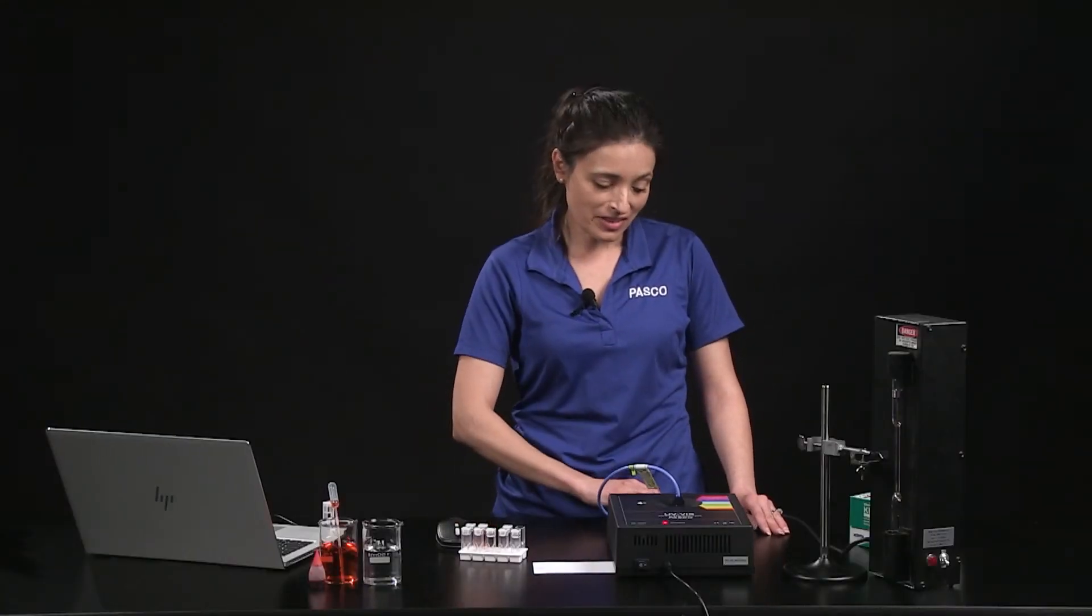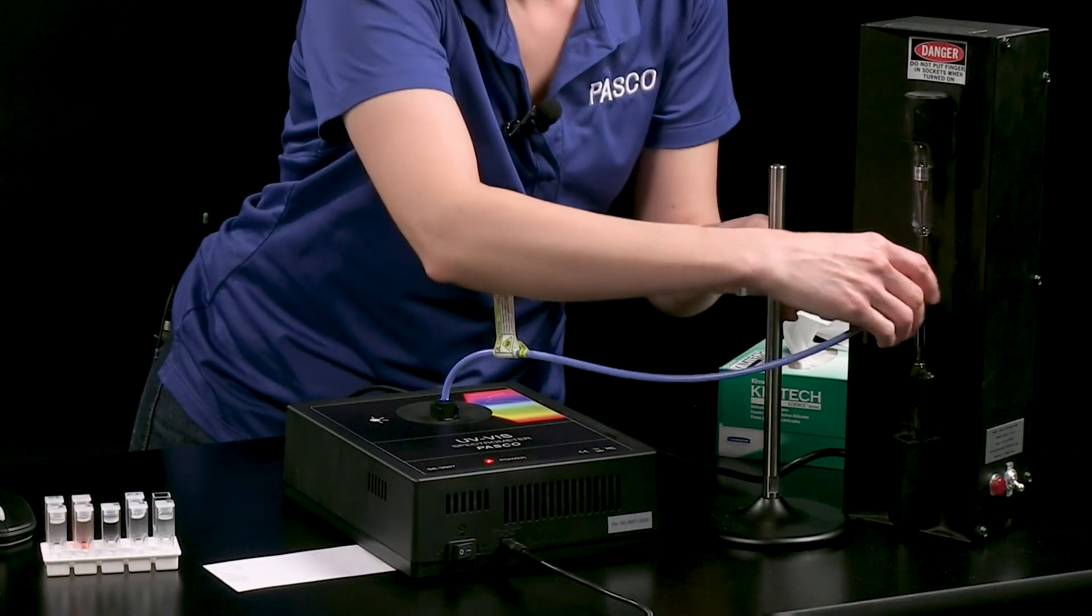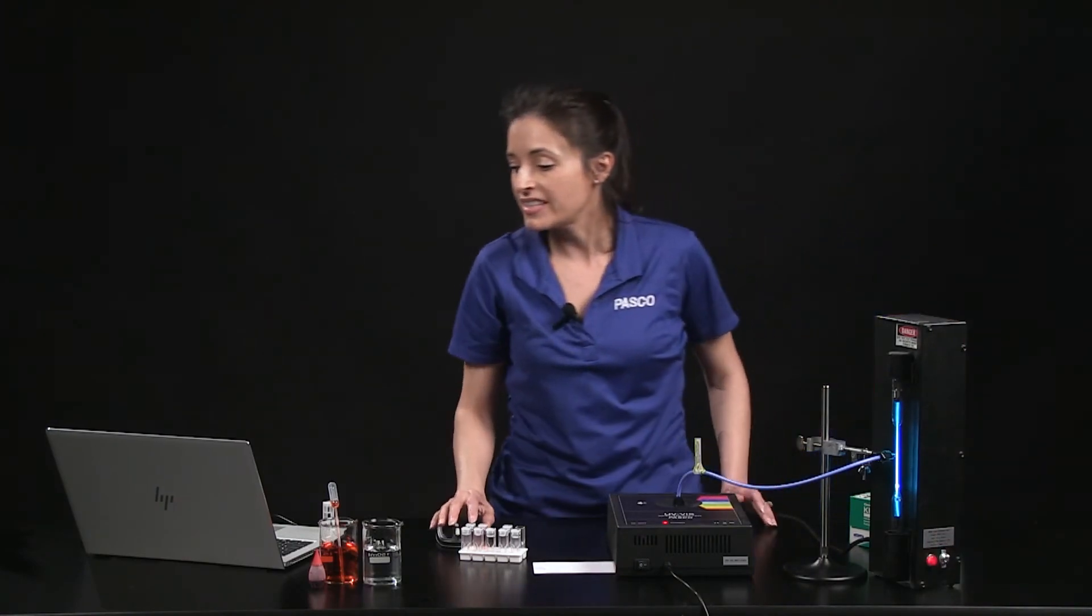Position the other end of the cable near your light source, but not touching. Turn on your light source, start collecting data.